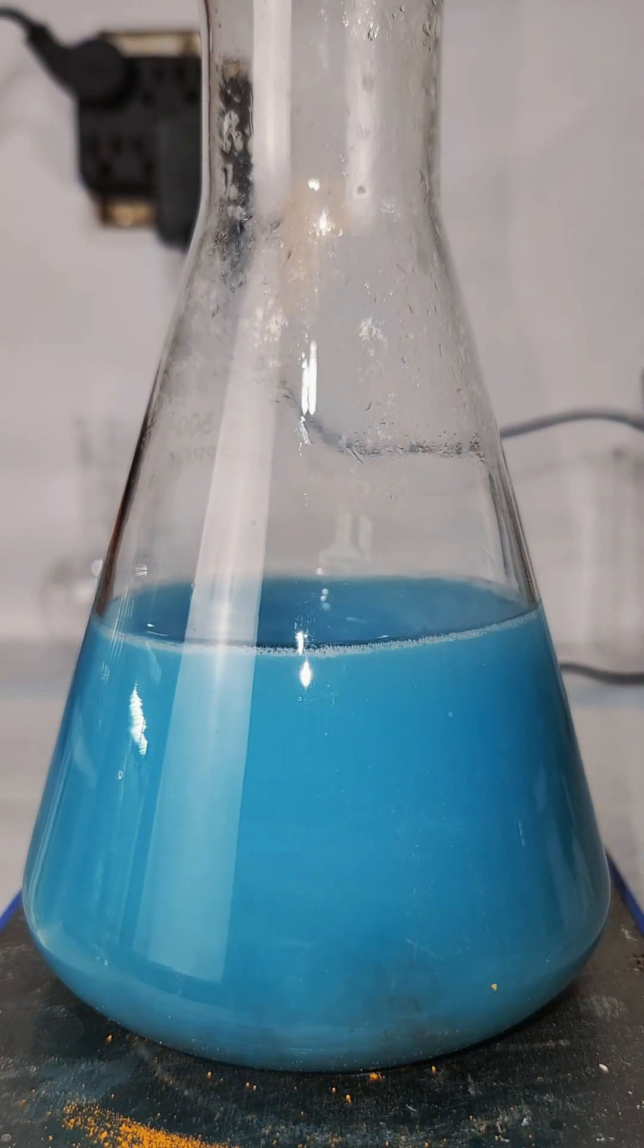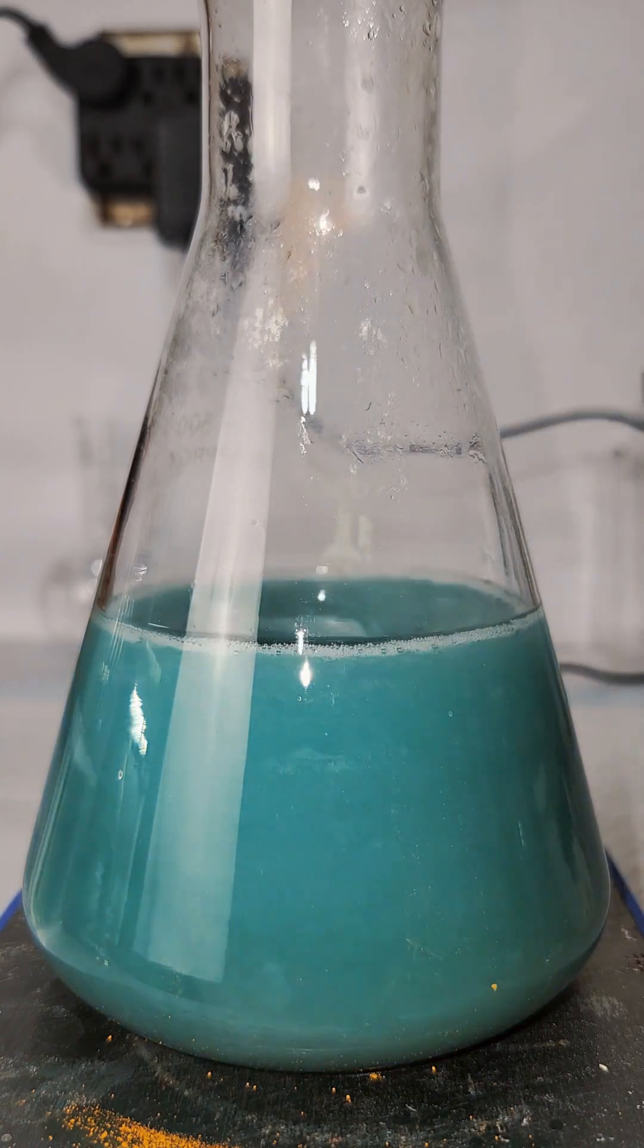This is a classic example of a successive redox reaction, and you can do this with any transition metal, but vanadium has more oxidation states than most, as I mentioned earlier.